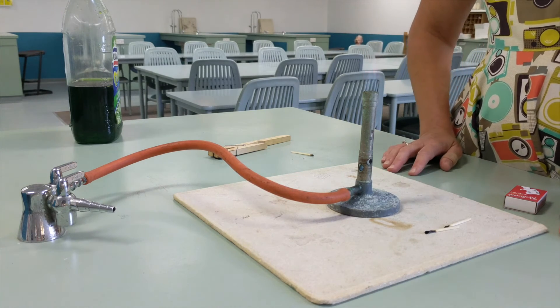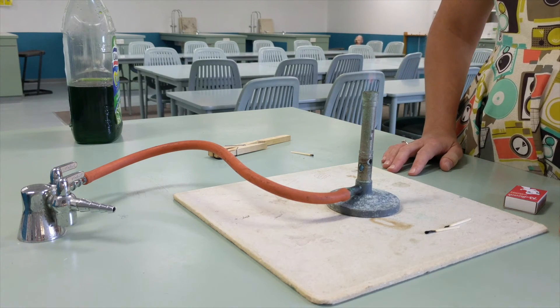As you can see, this flame is a lot harder to see. It's also very hot so you need to be careful.